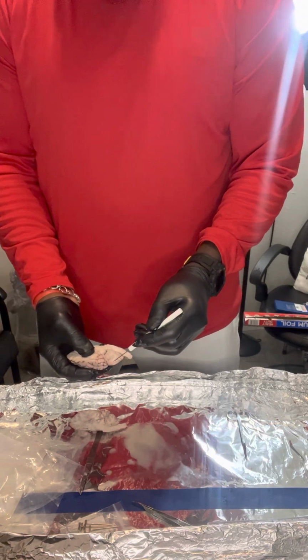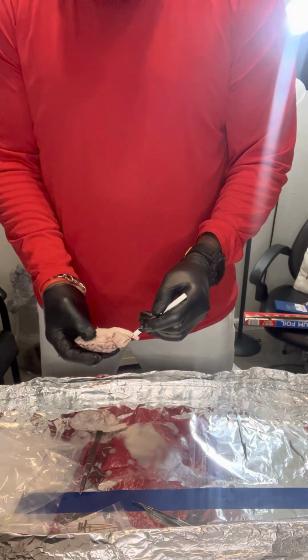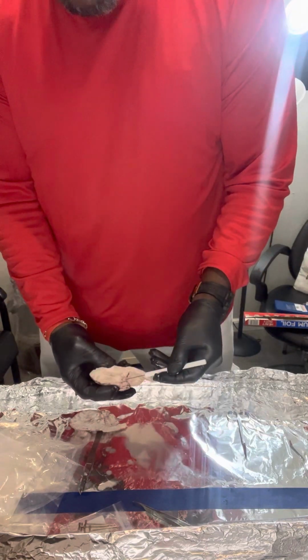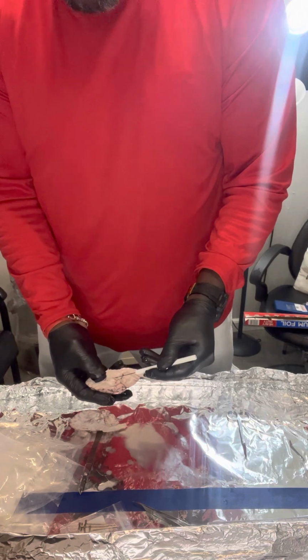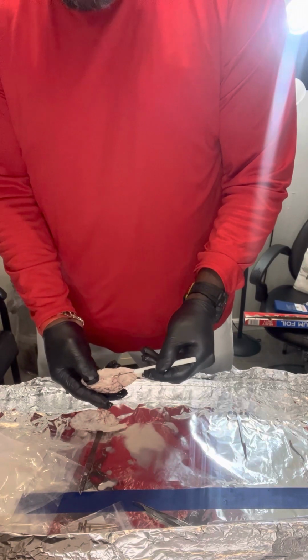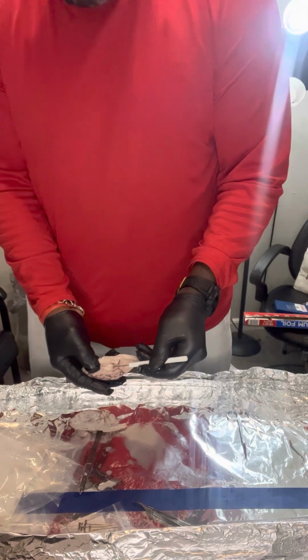The pineal gland is what I want to look for next. And if I move over this direction, so this was the cerebellum. So the pineal gland is in this area. Right here, I believe. You see this little fatty area? Right in there, based on what I was reading earlier today.